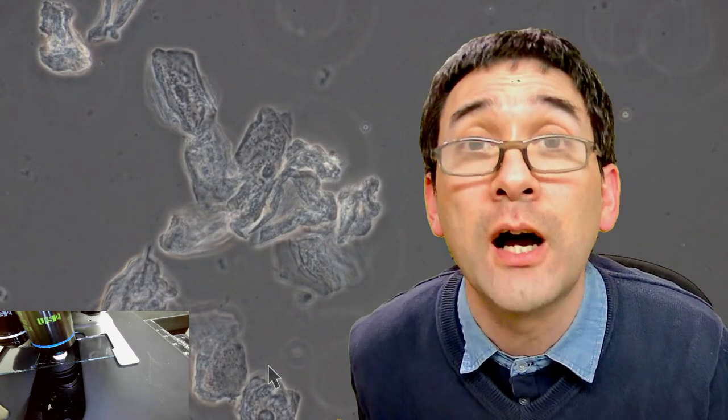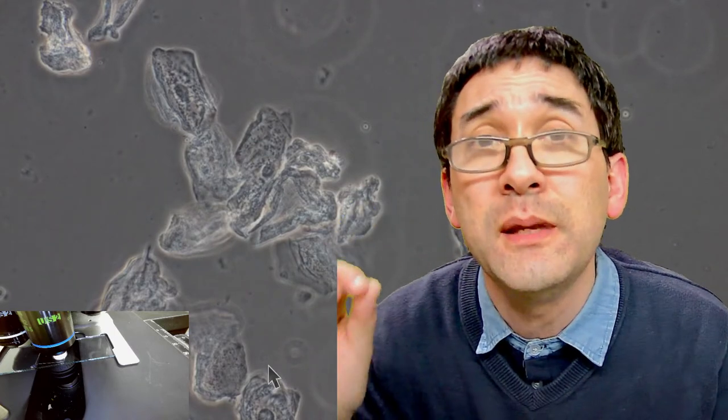To confirm: phase contrast objectives can also be used for bright field microscopy. The image quality is slightly lower because of the phase ring — there's a small loss in contrast and clarity — but it's almost unnoticeable and you'd need a side-by-side comparison to tell.